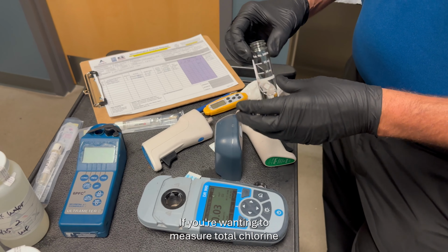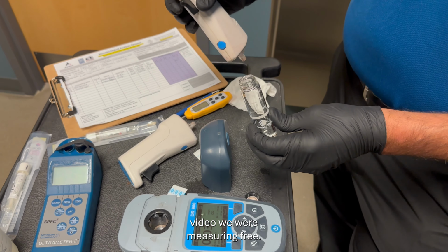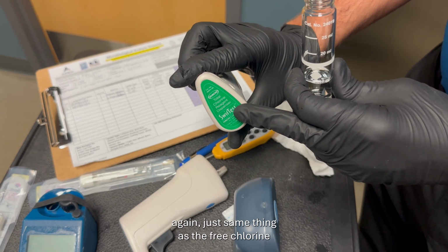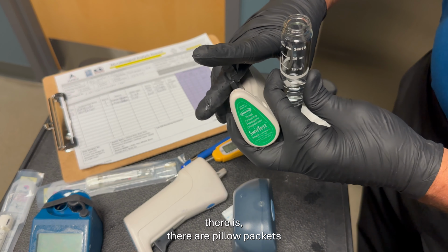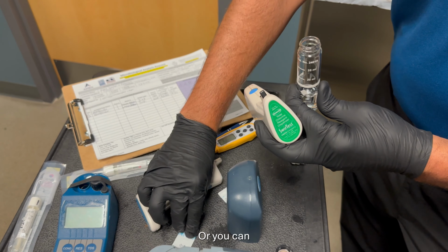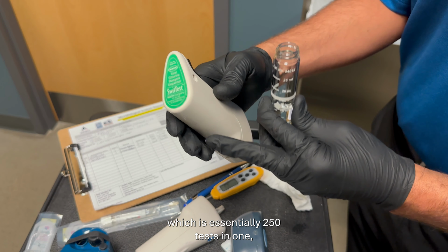If you're wanting to measure total chlorine, from the previous video we were measuring free. If you're wanting to measure total, again, it's the same thing as the free chlorine. There are pillow packets that you can use, just like this, or you can use the Swift tester, which is essentially 250 tests in one.